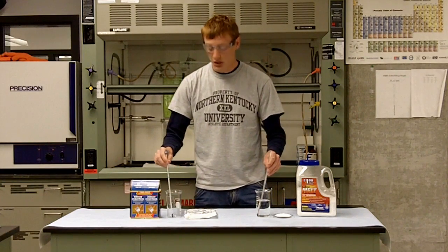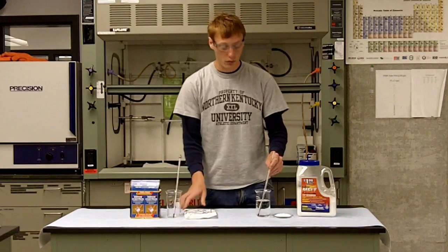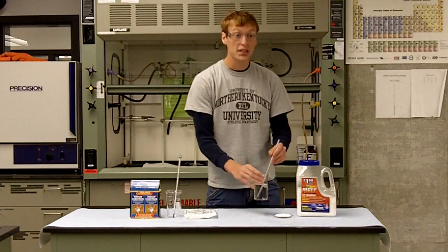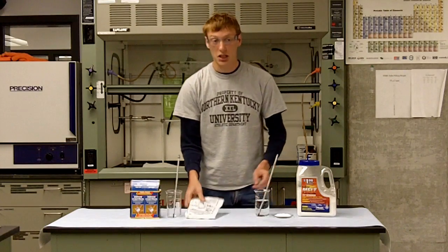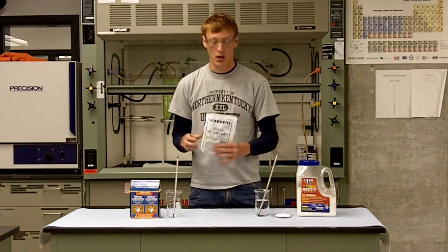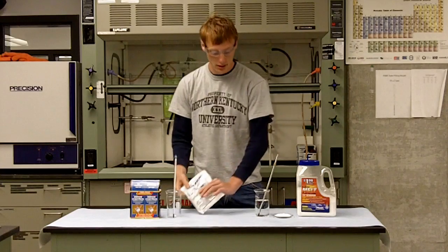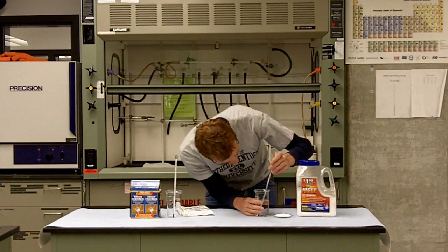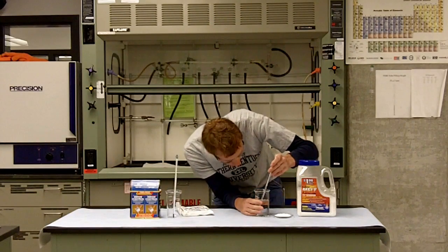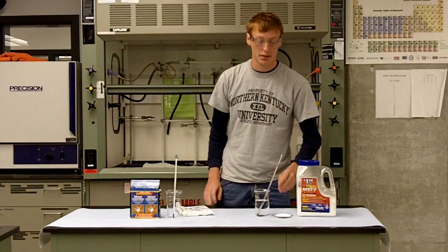Both of these contain tap water. In this beaker we have tap water and in this we have a water pouch. The starting temperature is 24 degrees Celsius.